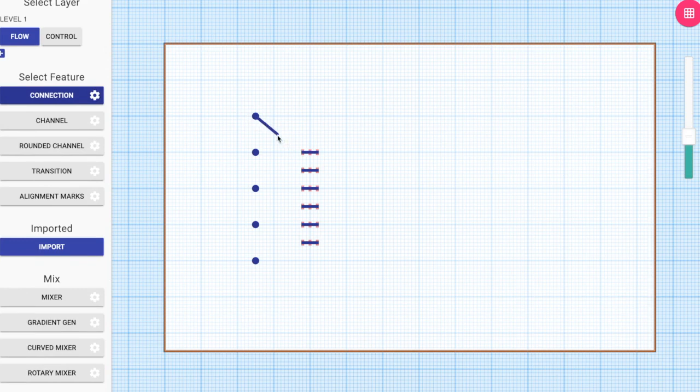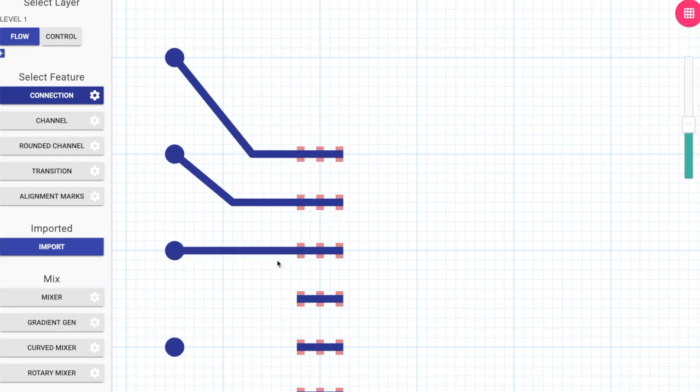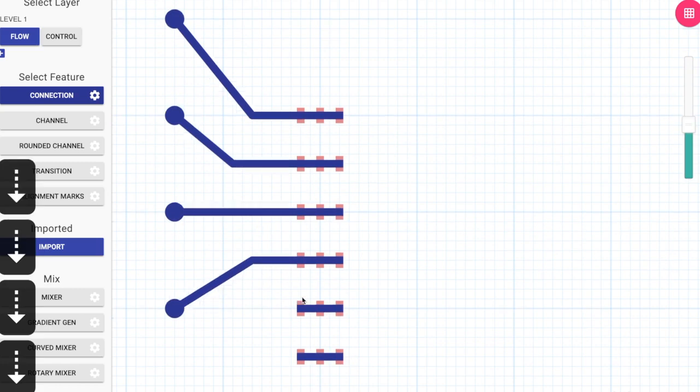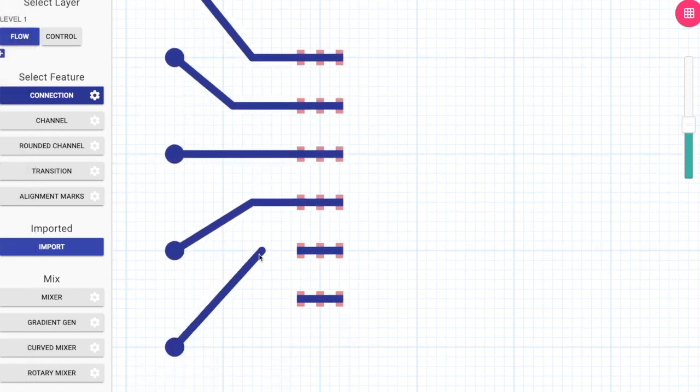So then we can create a connection using the connection tool, where we actually connect the pumps and the ports. By just left clicking on the port, we start the connection, and we terminate the connection by left clicking on the pump. We can also place waypoints on the way, as we can see right now, by just left clicking it on the canvas. I'm panning down with the down arrow button.